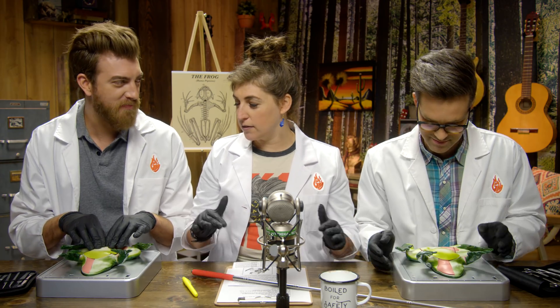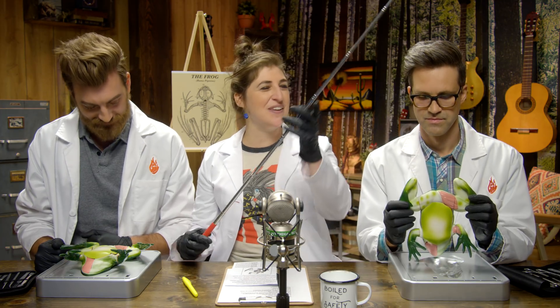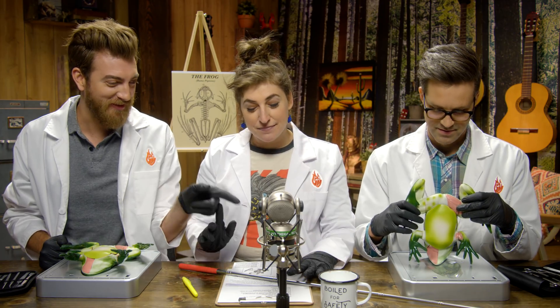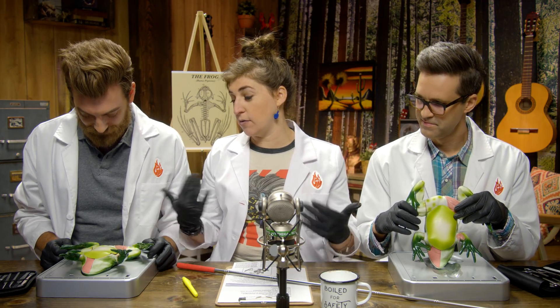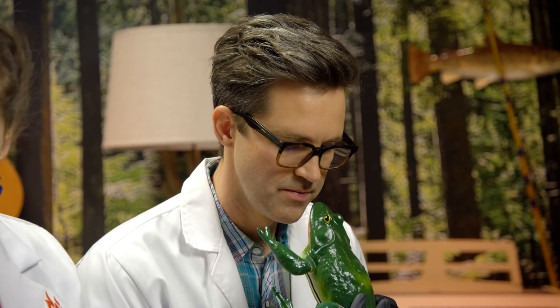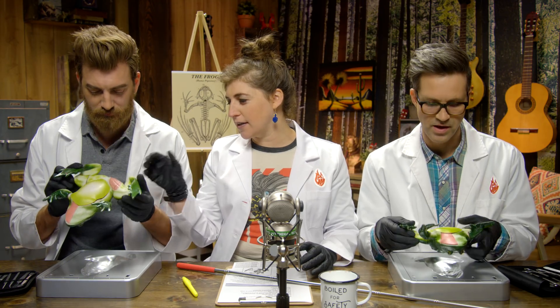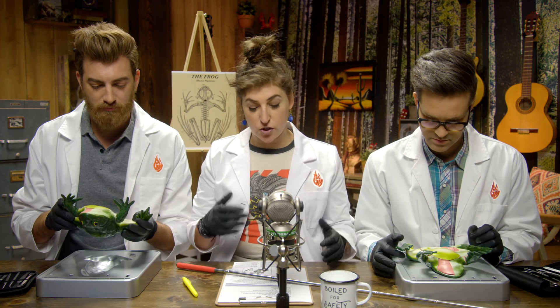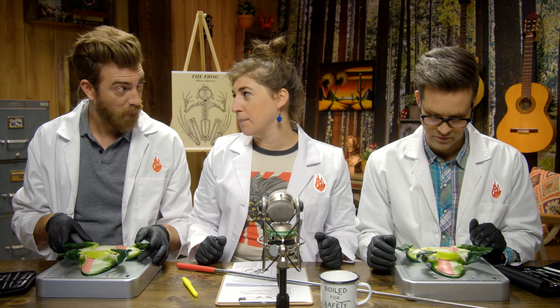So interestingly you won't see it on the outside. This opening is called the cloaca — that's where everything goes in and out. The way there are external ways to sometimes determine if it's a male or a female — males have different muscles, males are generally smaller than females. We can't really tell about Frandy and Charles, but you can tell on the inside if it's a boy or a girl. Sometimes there's eggs — we'll get to that in a minute. Let's get in there.